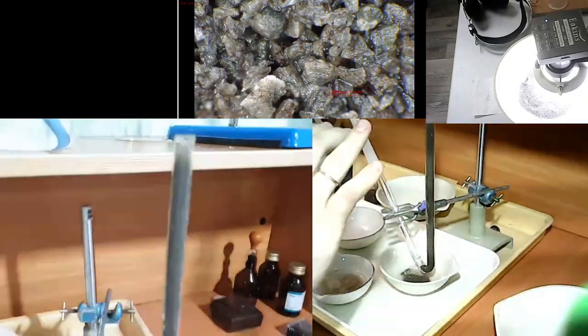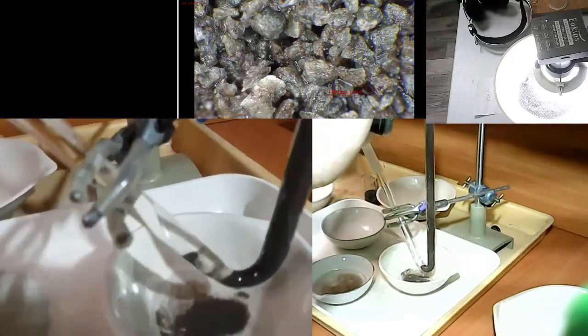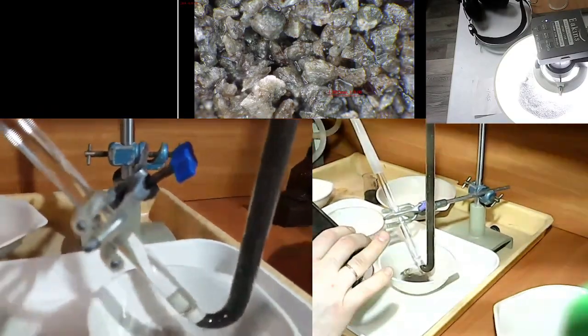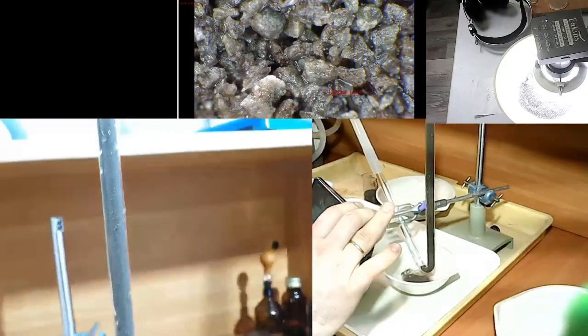So now it is just used for understanding the best regime, and later, once regime is set up, you can always use all the same regime, the balance of the sample, the balance of the fraction.